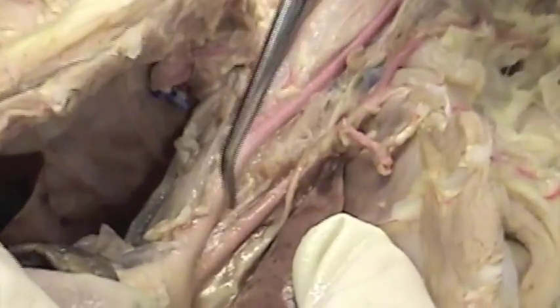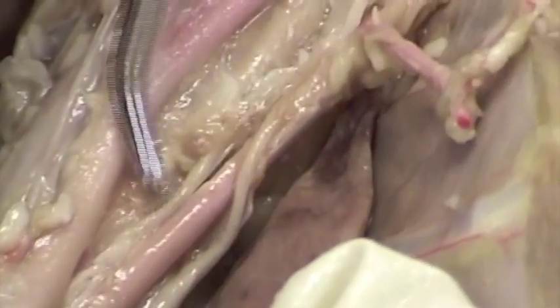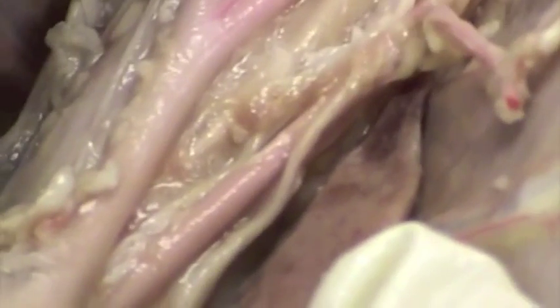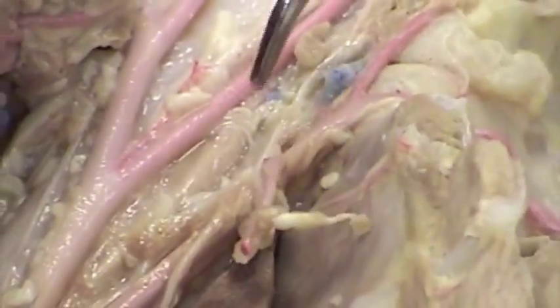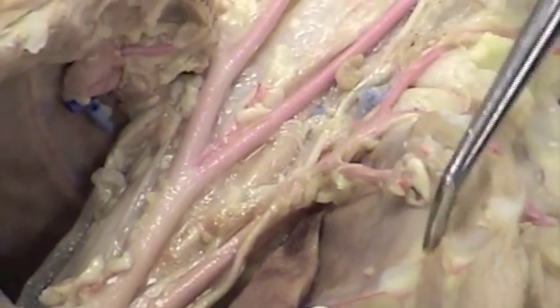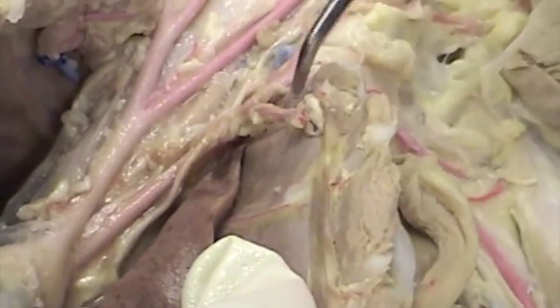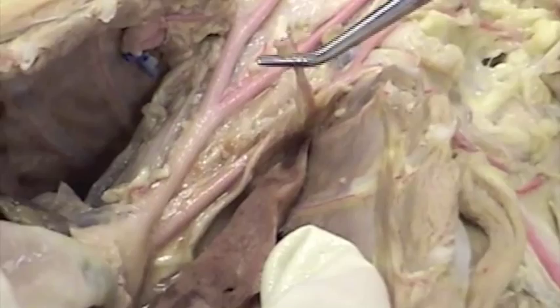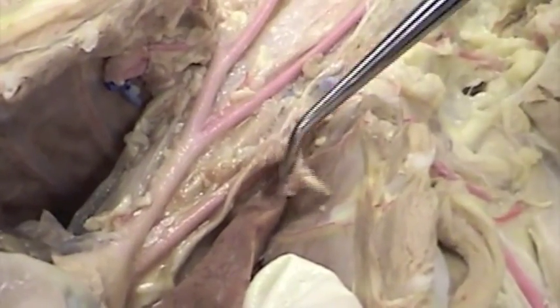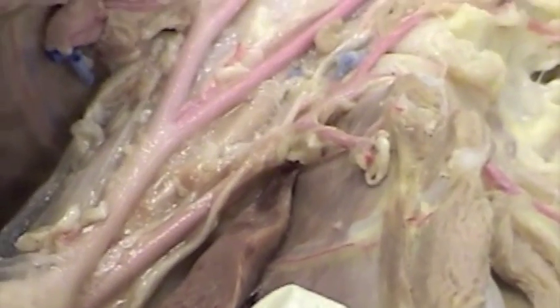One last artery we need to add in the thorax. Off from the subclavian artery, we have the internal mammary. Here's the internal mammary artery that branches and serves the anterior thoracic wall. This one in particular is cut because as I opened the thorax, I ended up needing to cut that. Okay, that finishes the thoracic arteries.